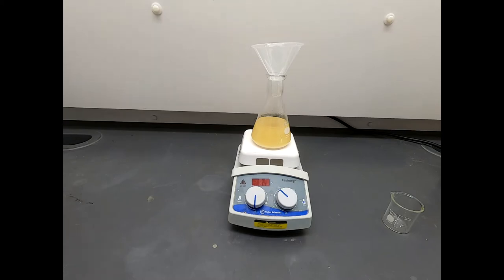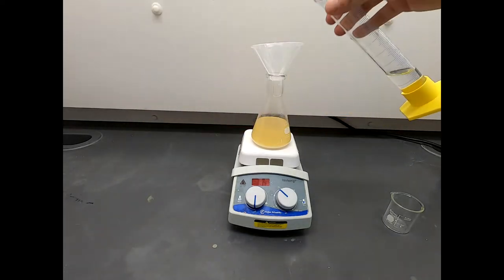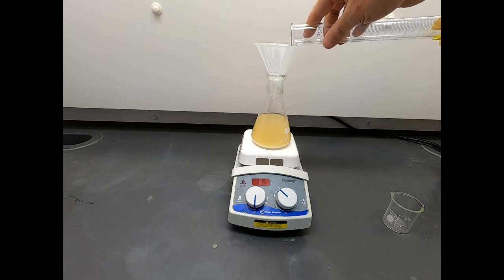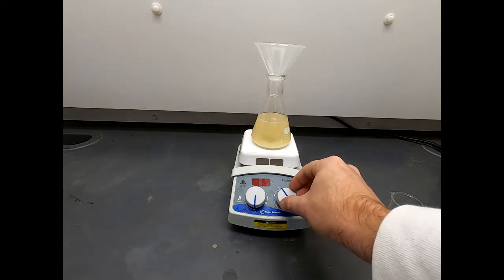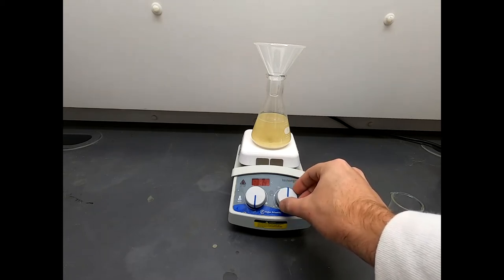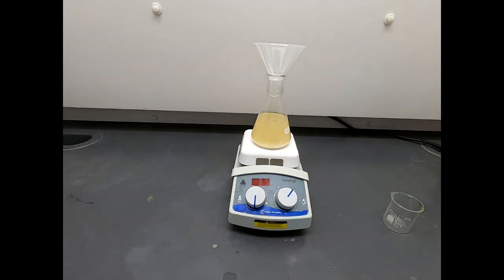Keep this stirring. Now you notice there's a lot of solid in there. That solid is our sodium azide that's not really dissolving. So what I'm going to do is I'm going to add some water to this. And if you've learned about SN2 reactions, you might say, oh no, you don't want water in there because water is a polar protic solvent. And polar protic solvents are bad for SN2 reactions. Well, sometimes you need to dissolve your reagents. You need to dissolve your salts. So we're going to throw some water in here. The great thing is that a polar protic solvent may make some nucleophiles more basic, but sodium azide is just so non-basic. It's no problem. But that gets everything in solution. You can see the solution is clearing up a little bit.